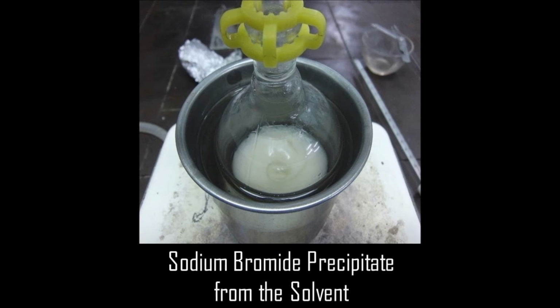Although warming may be required to start the reaction, it is quite exothermic. Do not add all the 1-bromobutane in one portion. Cool the reaction flask with an ice bath during the addition. Cork the Erlenmeyer flask between additions so that the 1-bromobutane does not evaporate.